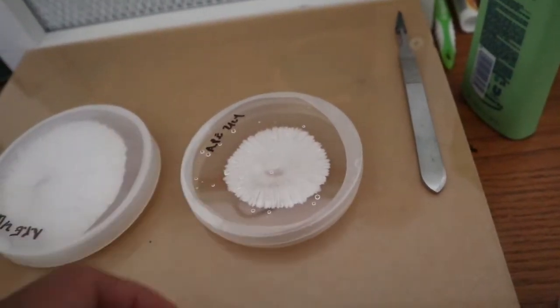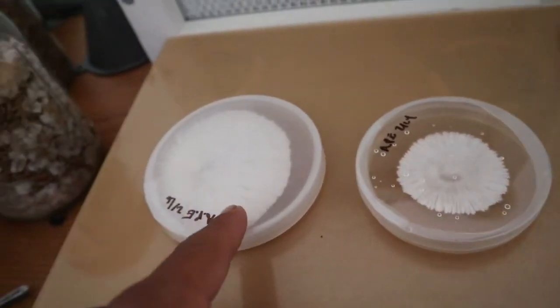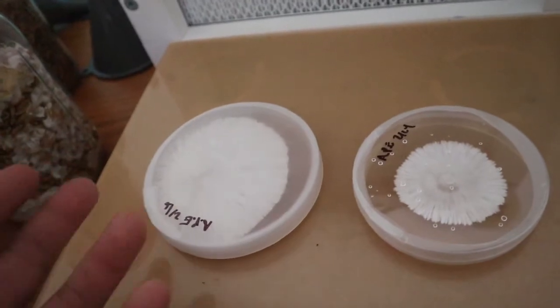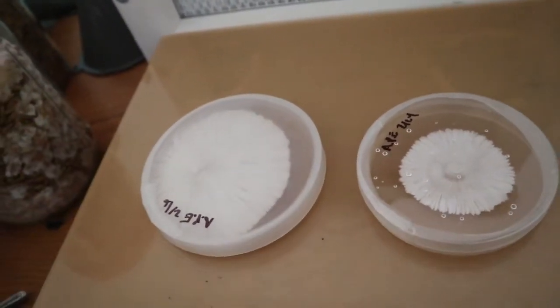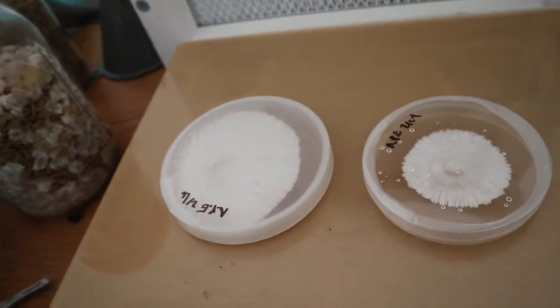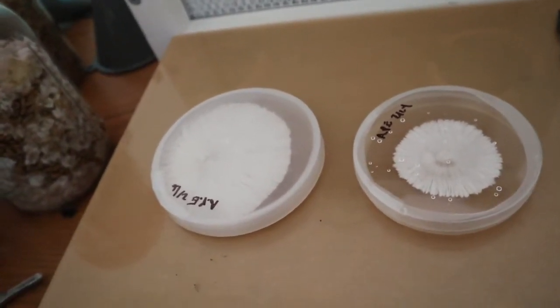You can't reuse it because of the material they're made out of. Now this one, the way to reuse it, let's say you're done, just empty out your agar, the dish. What I do is I spray it down with rubbing alcohol, then I wipe it down, then I wrap it in tinfoil.